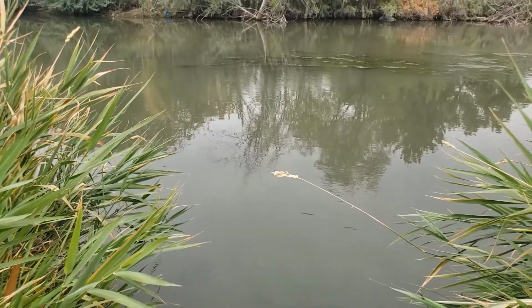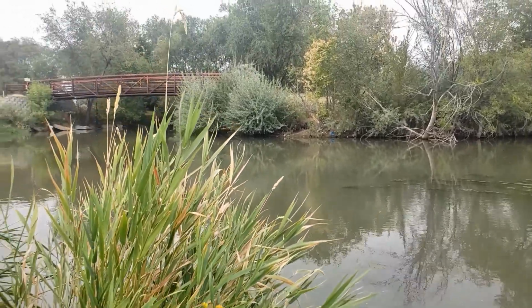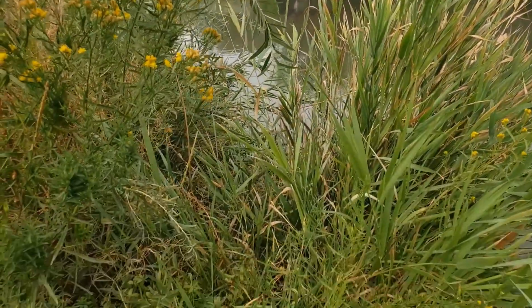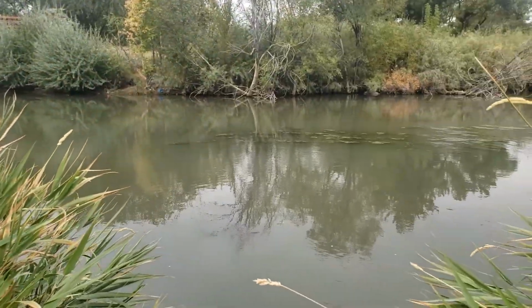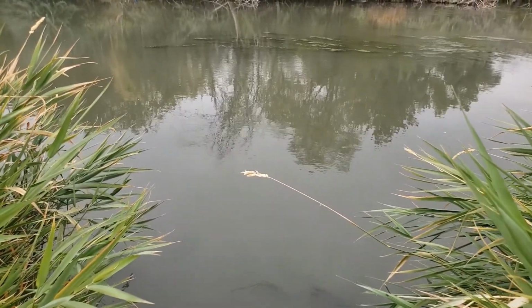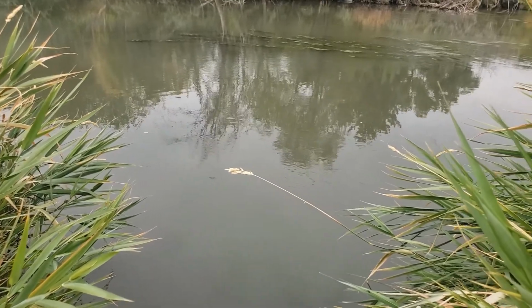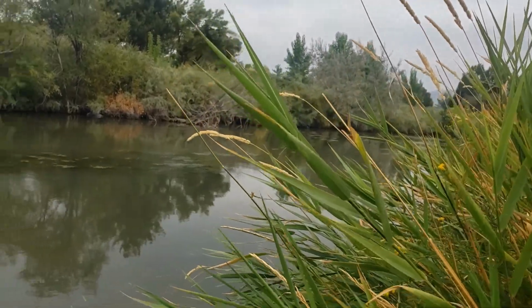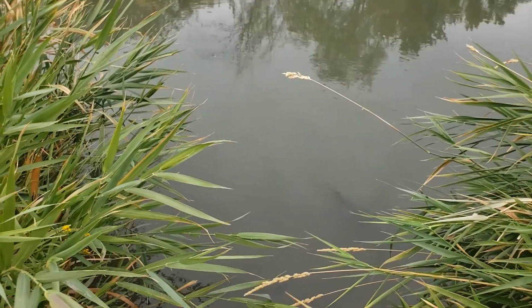We're also going to measure things like nitrogen and phosphorus, which can be indicators of how much nutrients are in the water. Here's some bees. So if there's lots of nutrients, oftentimes we'll see a lot more algae growing. And the nitrogen and phosphorus can come from places like runoff of farm fields. We're also going to measure the turbidity, which is how well you can see through the water.